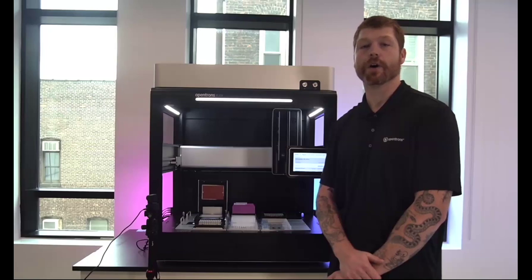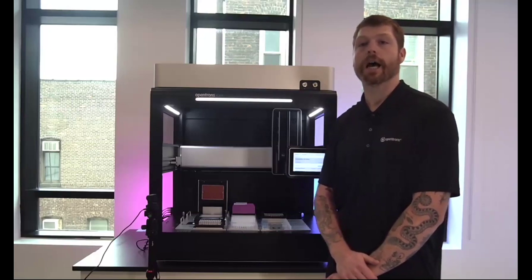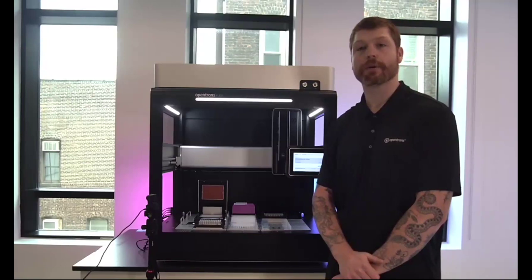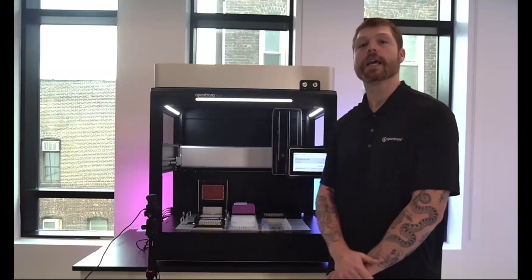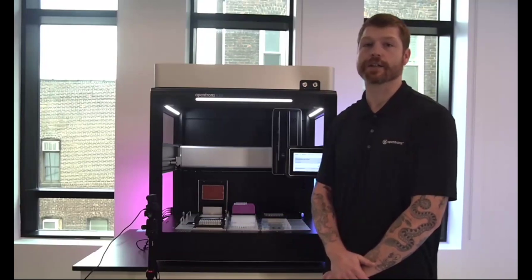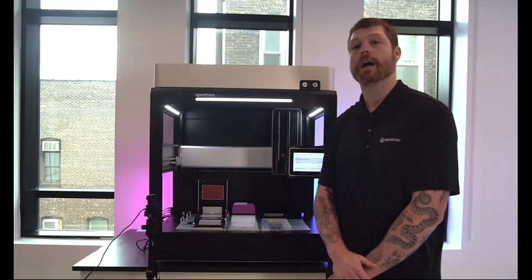These have 2 volume ranges for both of the pipettes. They can either be 1 to 50 or 5 to 1,000 microliter pipettes. And you could have 2 mounted at the same time. Or we also have a 96-channel pipette, which goes from 5 to 1,000. And actually one of the key features we are showing in the release is going to be updated partial tip pickup features for both the 96 head and also the 8-channel head. So really unlocking the flexibility of the instrument to allow you to do more with the pipettes that are available to you.